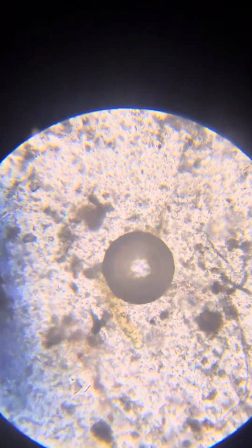It's an interesting question, because they vary not just in size, but also in how fat they are. And when they are pretty fat, you can see the white internal ring, which is very nice, I think. Let's zoom in even more.